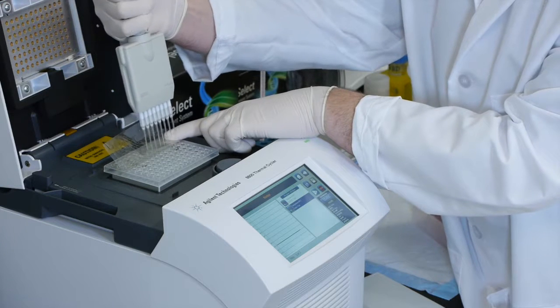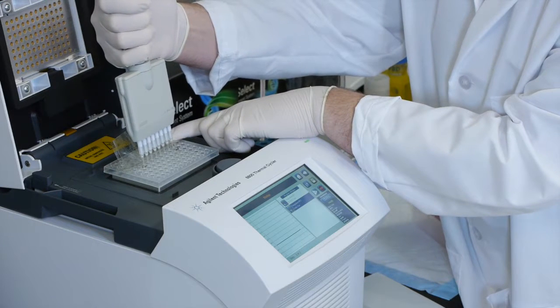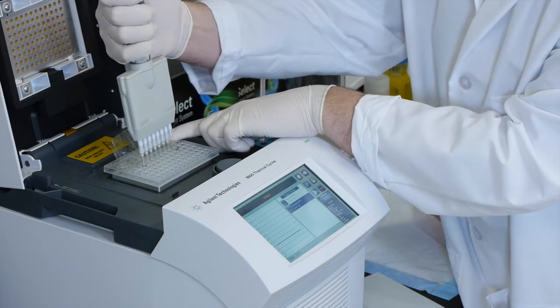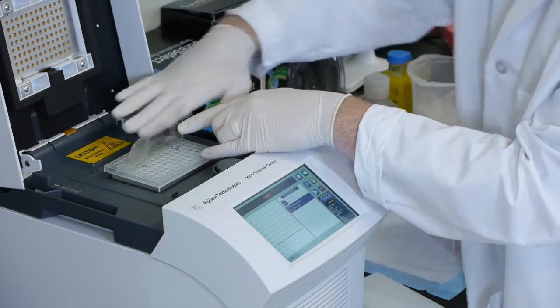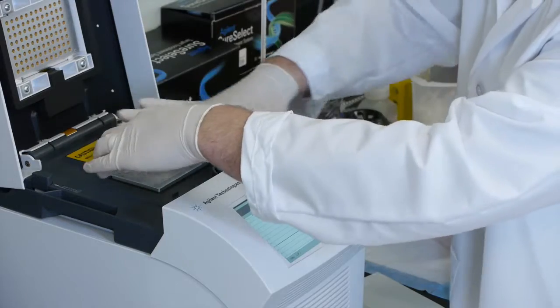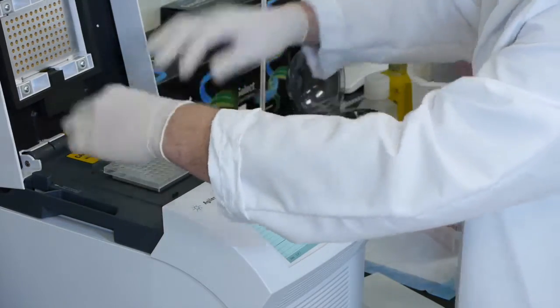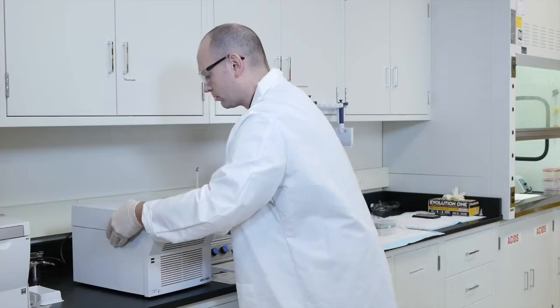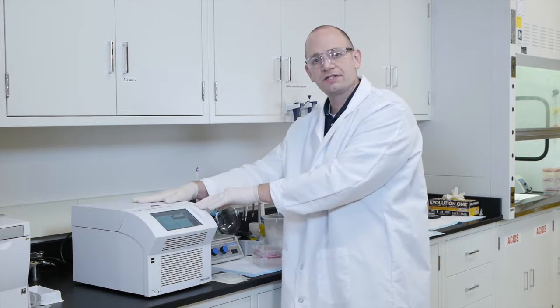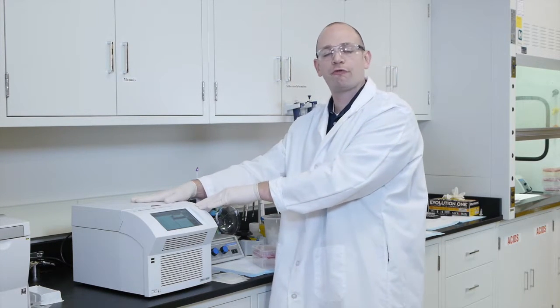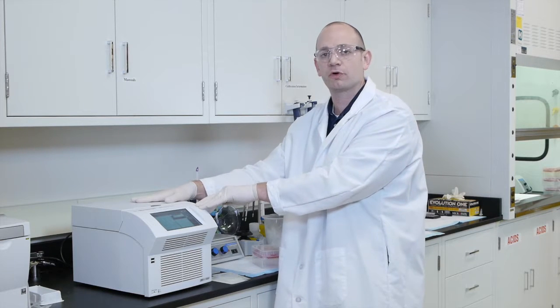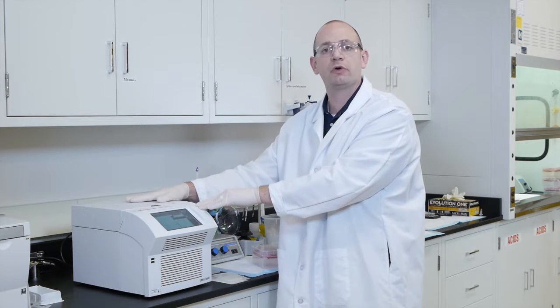Transfer the baits directly into the bottom of the well, and then quickly reseal the plate using the same seal. We're now going to allow this to also come to temperature for an additional two minutes before we perform the final step of the hybridization protocol, which is to mix all of our components together.